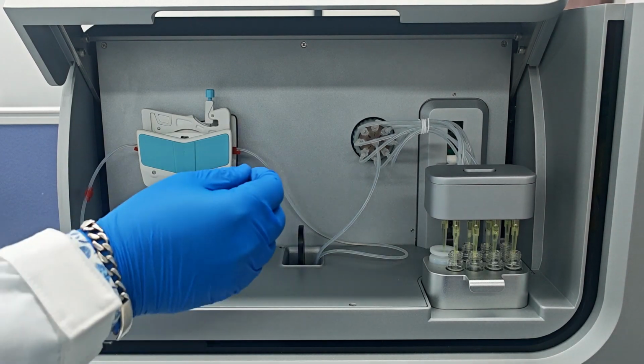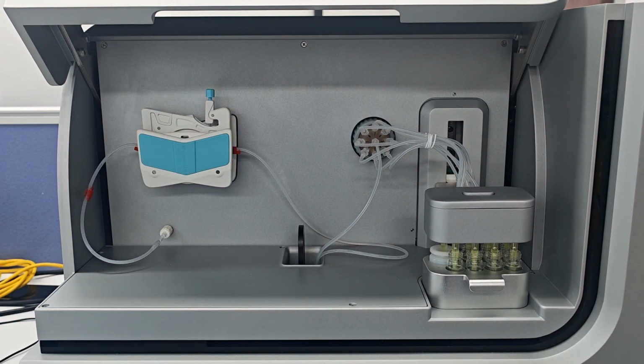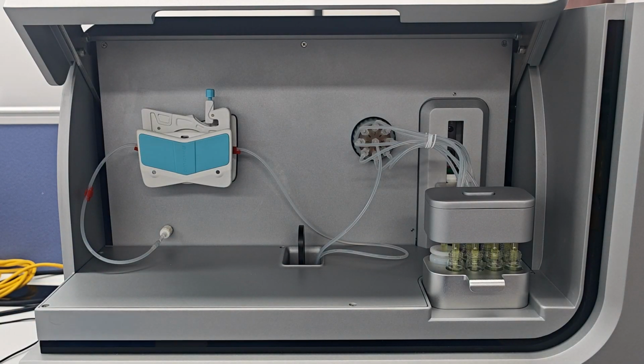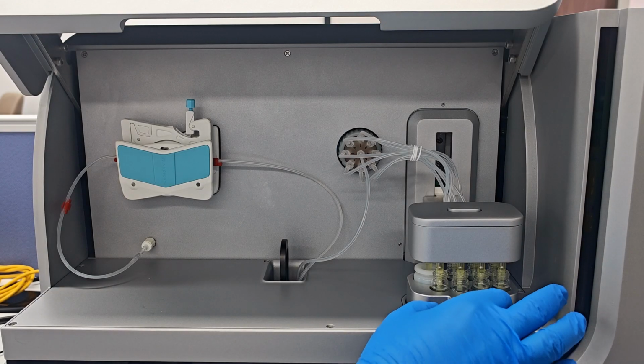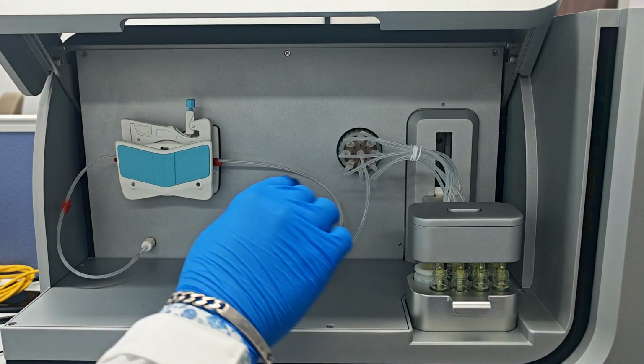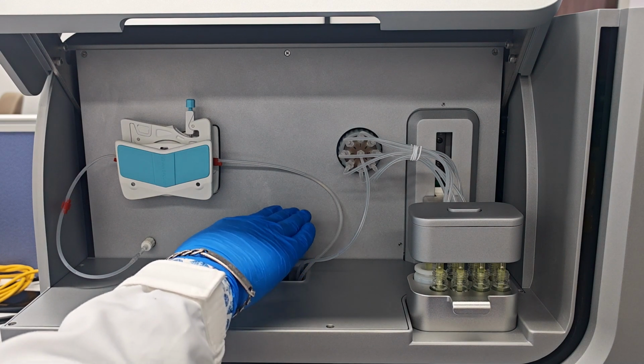As we can see, the pipette mechanism is going down back to our samples. And what is important is that the selection of the order which sample go first can be easily scheduled in the software.